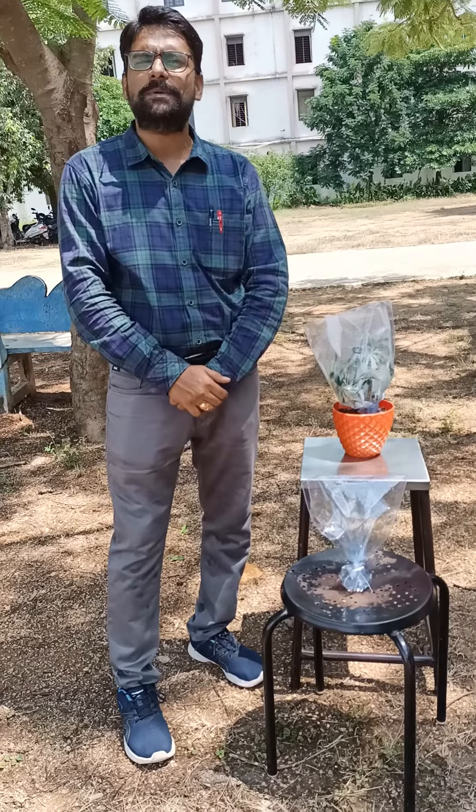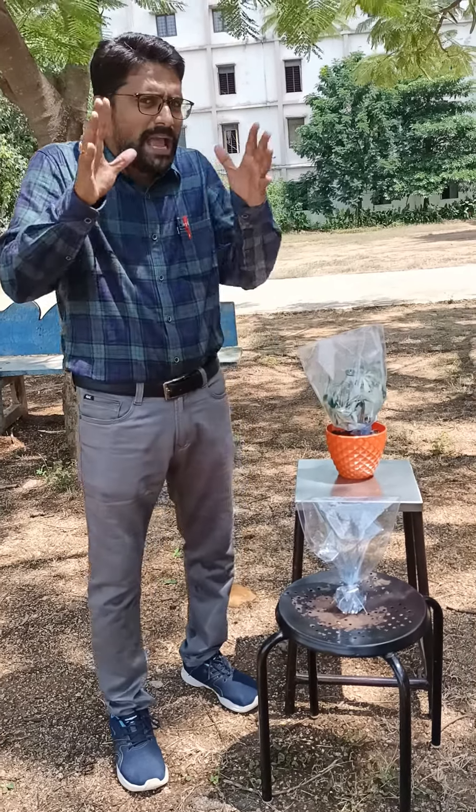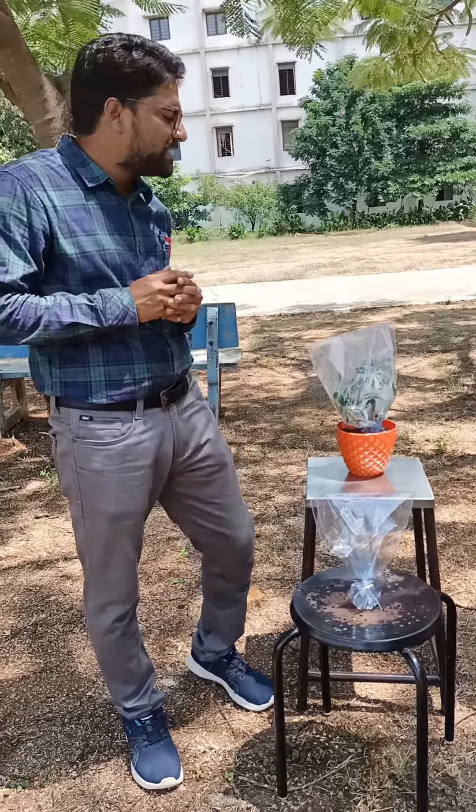Hi dear students, I am Basudev, TGT Bioscience from Tirumalai Palam School. Today I am here to demonstrate an experiment on transpiration.